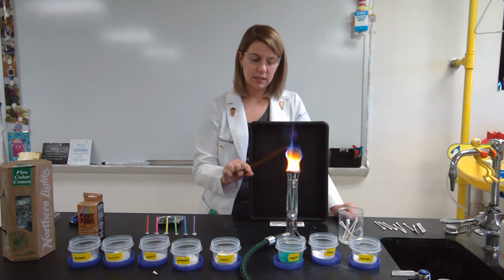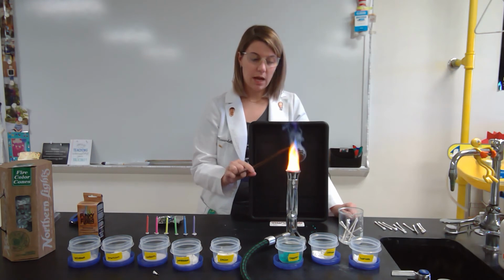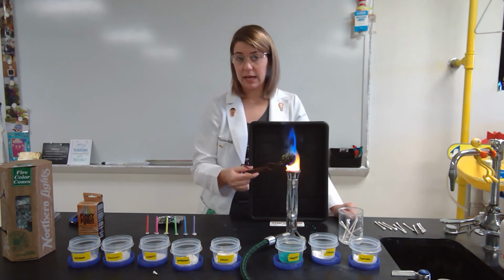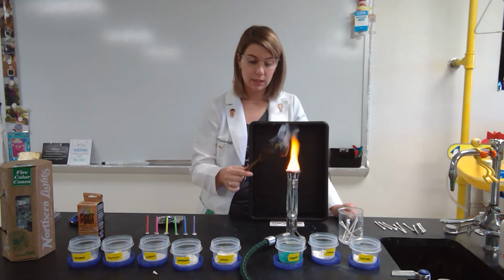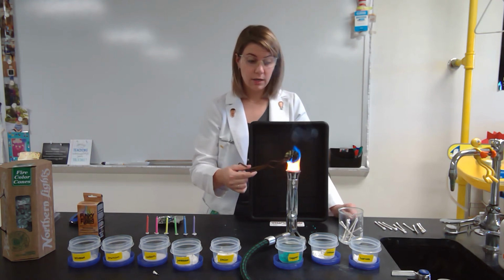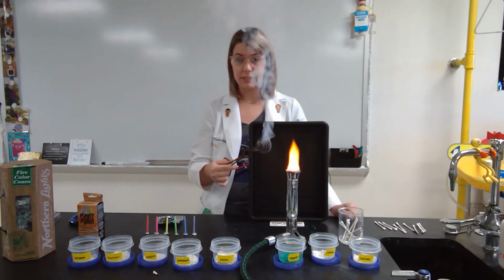So I'm seeing that this pine cone is burning a blue color with some green coming off of it. So I would suspect that they have put inside of this pine cone something with copper because our copper test was blue and it gave us that green color as well. So by putting different chemicals, that's how you get your different fireplace colors.